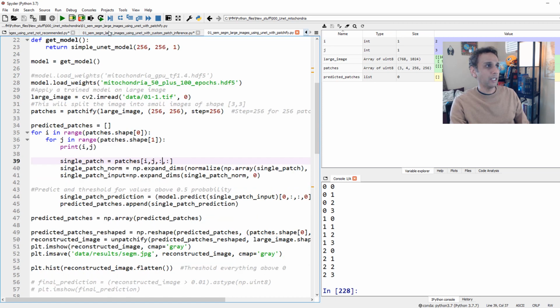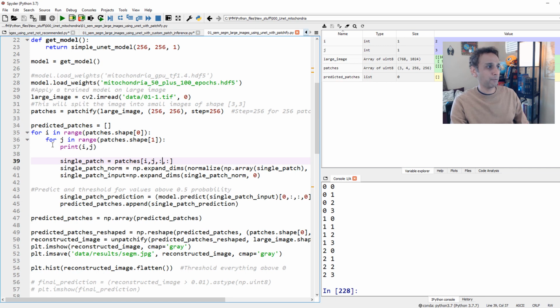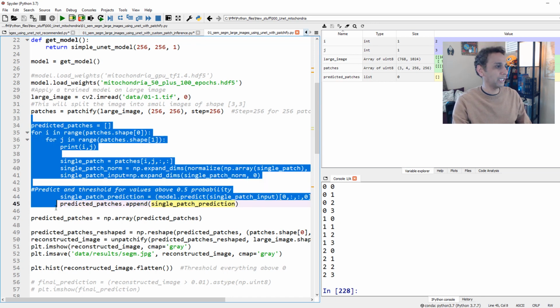My single patch, in this case, was something I defined, i to i plus patch size, because I was playing with the NumPy arrays. Here, it's pretty much the same thing. My single patch is my patches i, j, right? 0, 0, 0, 1, 0, 2, and so on with all of these. And then the rest of the story is the same. Expand dimensions, go ahead and model.predict. And at the end of this, to my predicted patches, append the result. That's it. Okay, so I hope this makes sense. Where are we? So let's go ahead and run these lines.